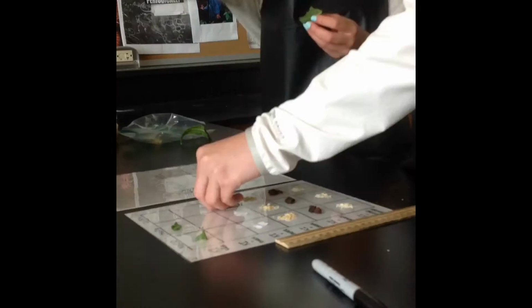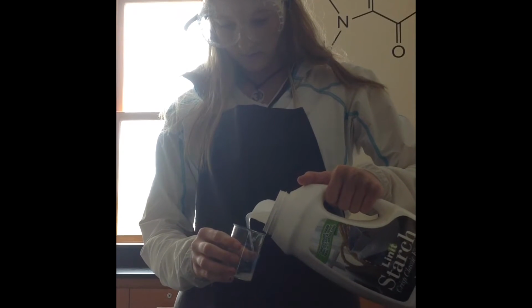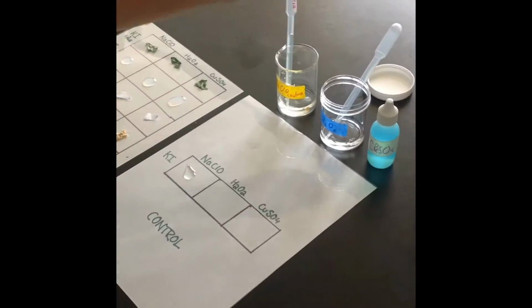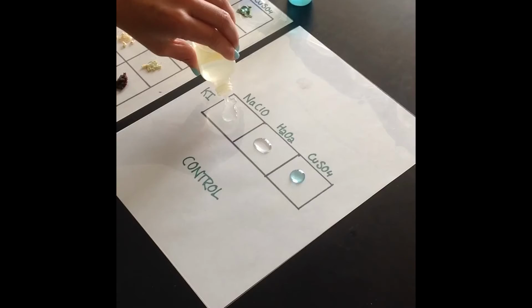First put down all the reactants, then put down all the chemicals, which are catalysts. This means they speed up the reaction. Then put down potassium iodide, which is an indicator. Make sure you set up a control group to compare your answers to, where instead of using just reactants, you use the catalyst. Now observe what happens to the reactants.